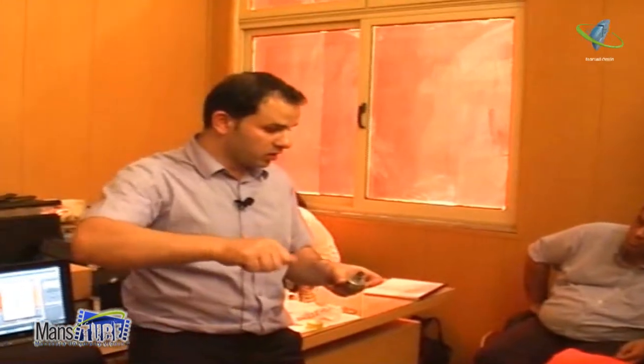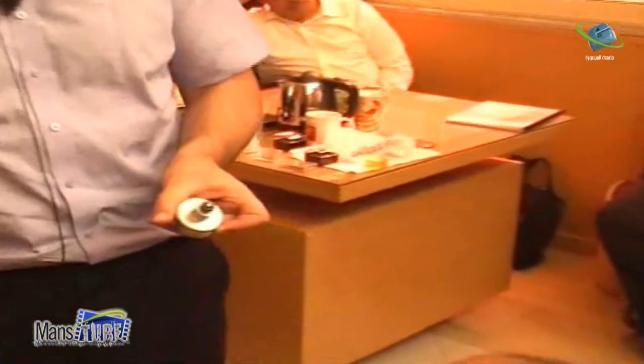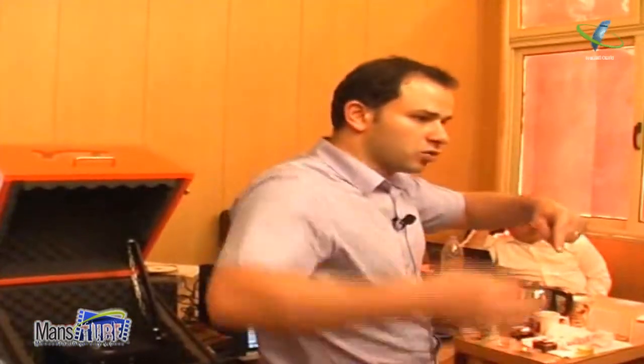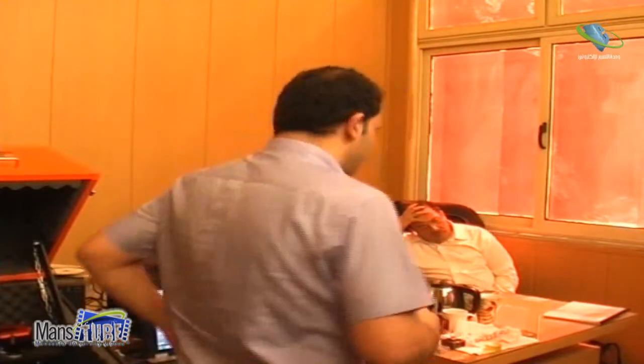With other AFMs, you need to adjust the laser sometimes in liquid, and you cannot see anything, and it's complicated. Here you see there is a small bubble, and this is the alignment structure. When the laser comes, it goes perpendicular to the liquid, and then you don't need to adjust the laser. Okay? Because going from air to water, the normal is always reflected in the same direction, while if you have an angle, it's different.